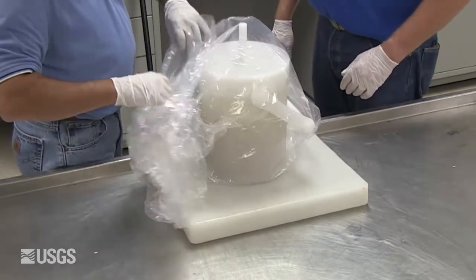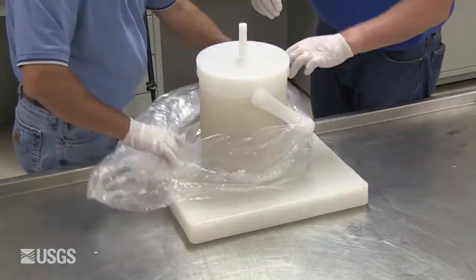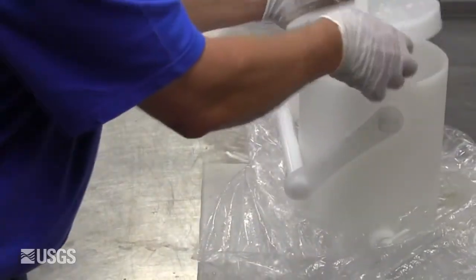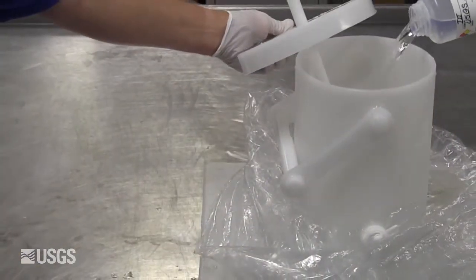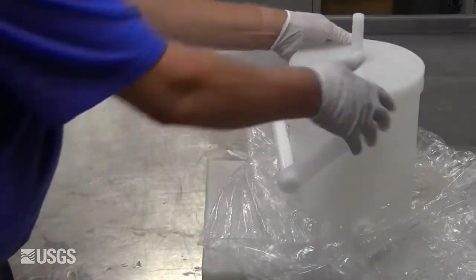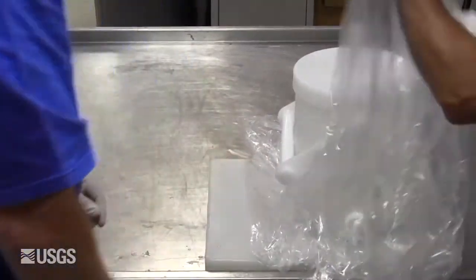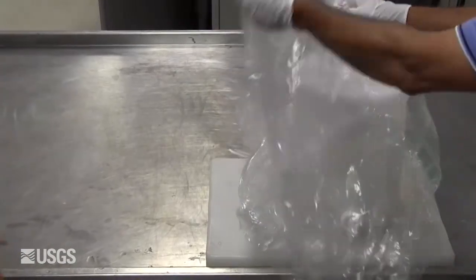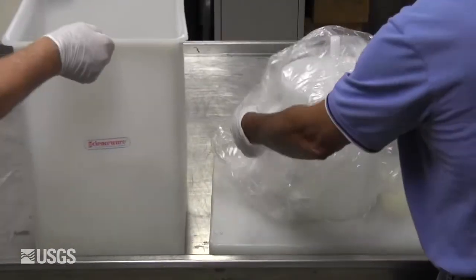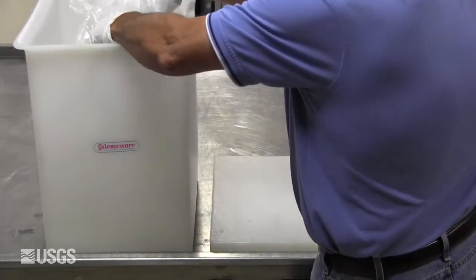If the churn will be reused in the field, disassemble it and clean it on site while it is still wet, as described in the National Field Manual Chapter 3. If the churn will not be reused during the field trip, rinse it with DI water before it dries out, place it in a plastic bag, and in the churn carrier for transportation back to the office laboratory for cleaning.